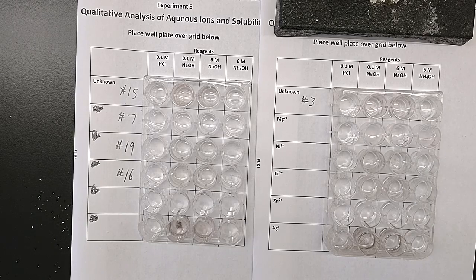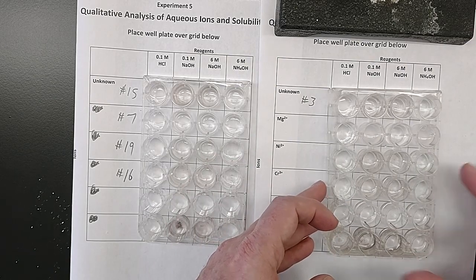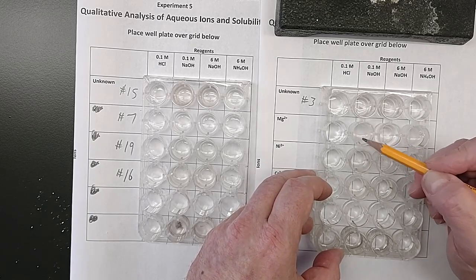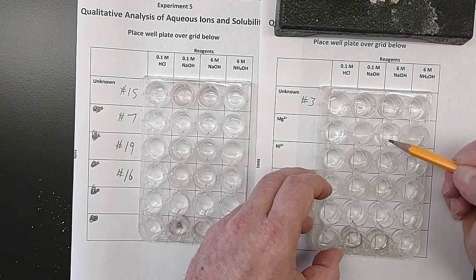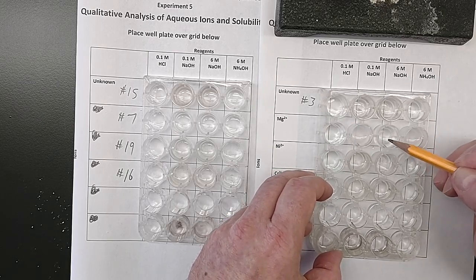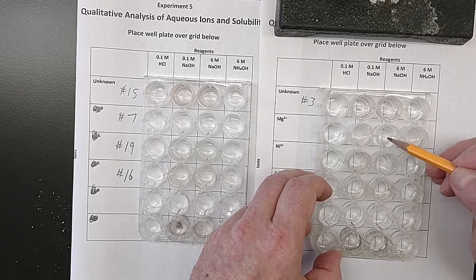Now, the magnesium was clear and colorless when I started, but if you look, in the NaOH one, the dilute one, if I move it over the line, you can't really see the line there anymore because this is cloudy and white. The 6 molar sodium hydroxide also, it's a little cloudy and white. Cloudy and white with the ammonium hydroxide. I can't see that line anymore. So I don't know why this one is a little bit lighter, but we could record that if we wanted to. This seems to be a little bit lighter, even though it's a more concentrated 6 molar sodium hydroxide.